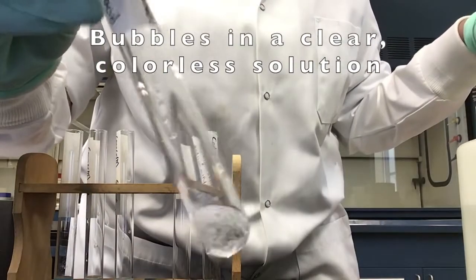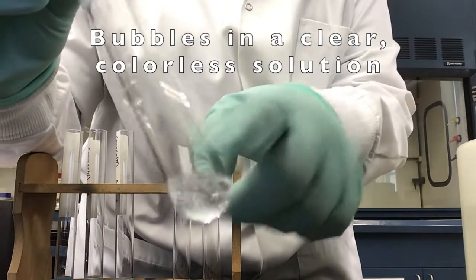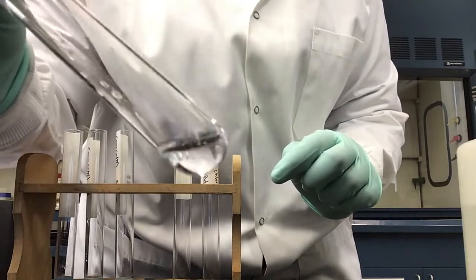Immediately after adding our sulfuric acid, we see bubbles and an audible gas release from our test tube. The solution is still clear and colorless with bubbles.